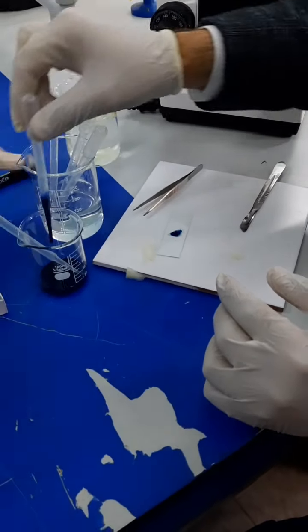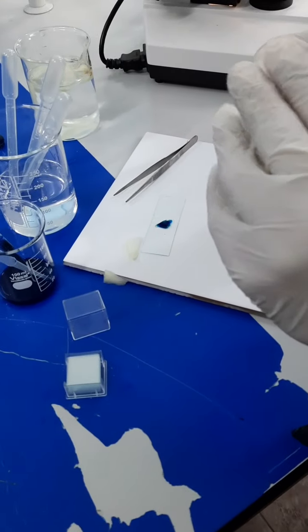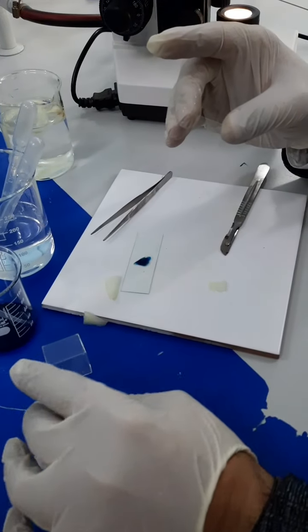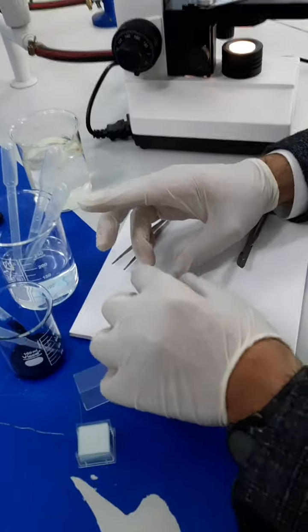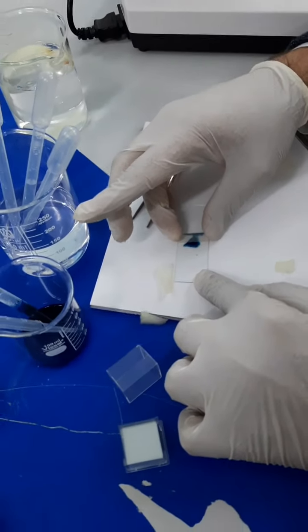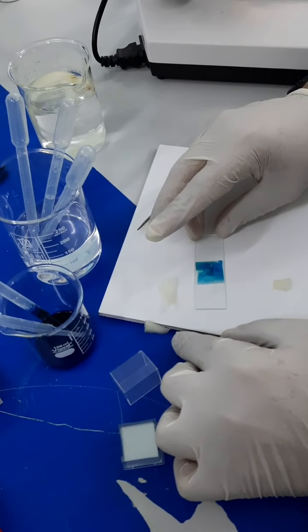After you do so, you can get the cover slip. The cover slip is this small square of glass. You use it so as not to damage the lenses of the microscope itself. It's very thin, so make sure you take only one. Now after you do so, you hold it from the sides and go at a 45 degree angle, and simply you drop it, so as not to trap any air bubble inside.